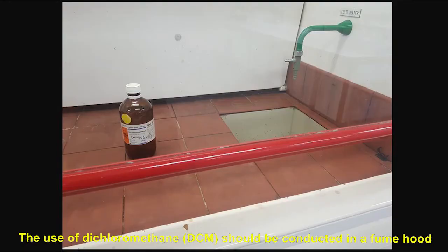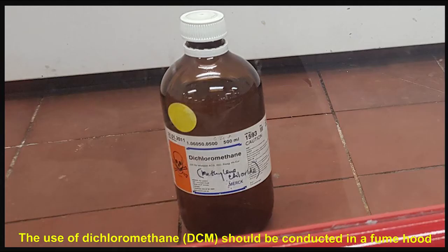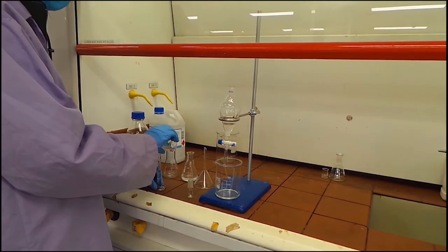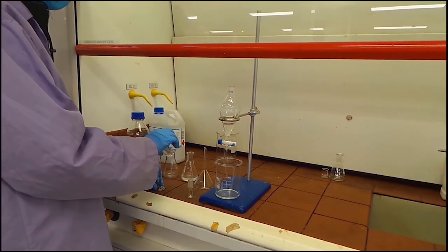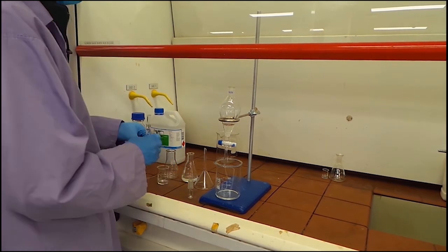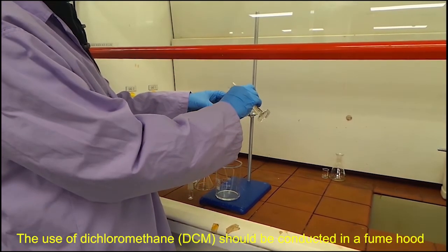Now you can add the other liquid. If the method wants you to extract, you will need to use an organic solvent. If it wants you to wash, add water. In this case, I wish to extract so I put in an organic solvent.